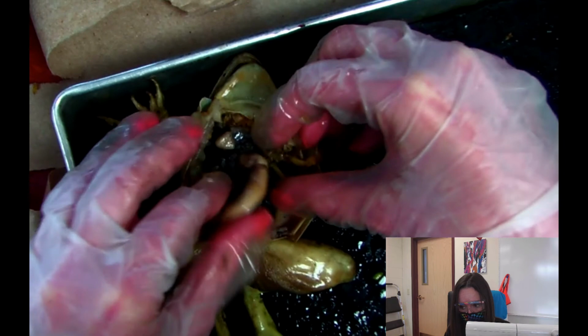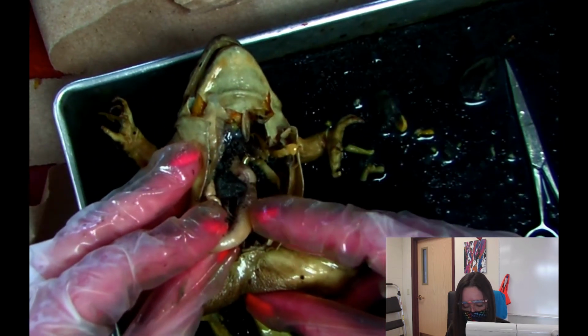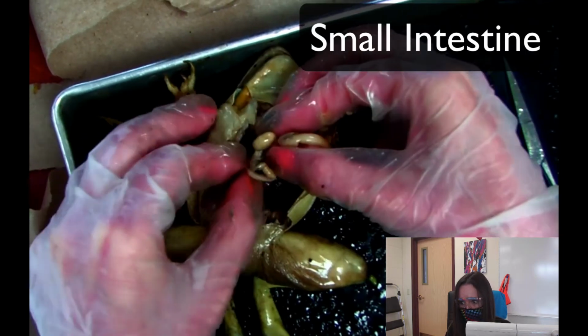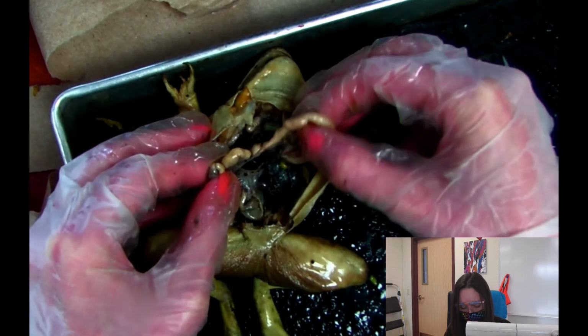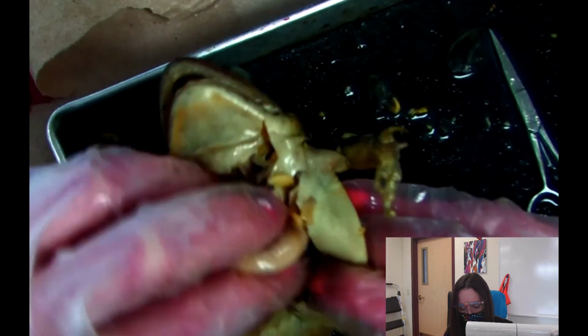So here's the stomach, right? So there's the stomach, this big part right here. And then you have the small intestine. So the small intestine's next. So it goes from the stomach to the small intestine. And at the bottom, it's actually kind of hard to see, but the bottom part right here, that's the large intestine.